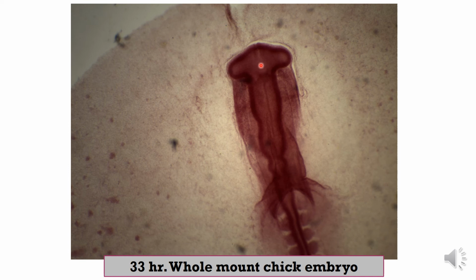And this is the telencephalon, diencephalon, and you can see the optic vesicles from the diencephalon, and mesencephalon, rhombencephalic isthmus, metencephalon, and these are the neuromeres of the myelencephalon.